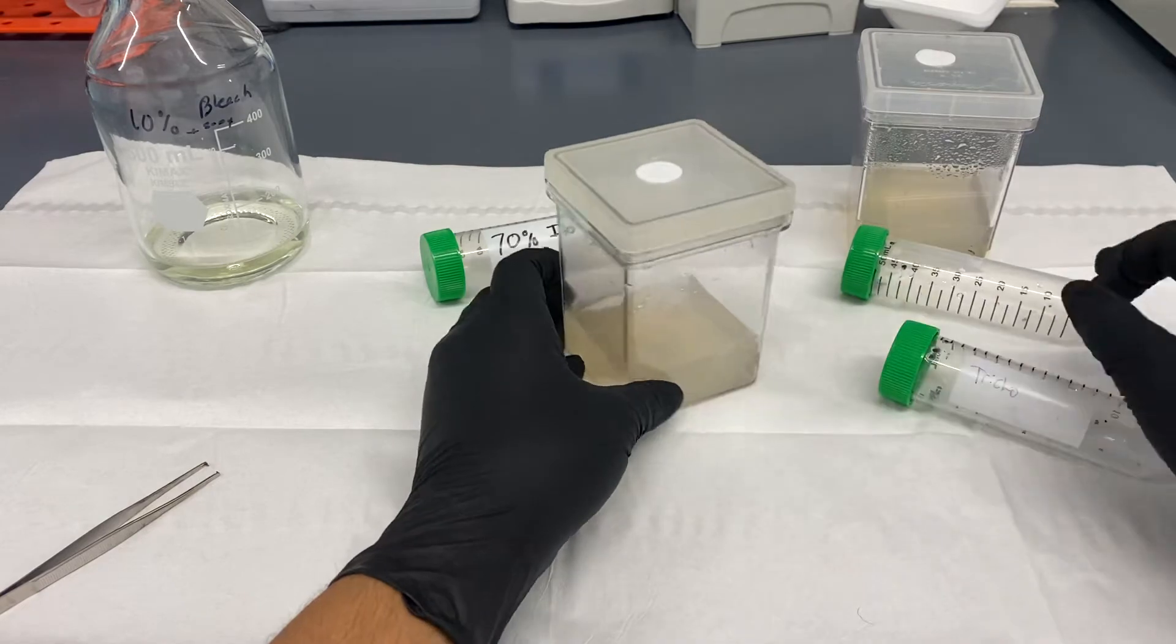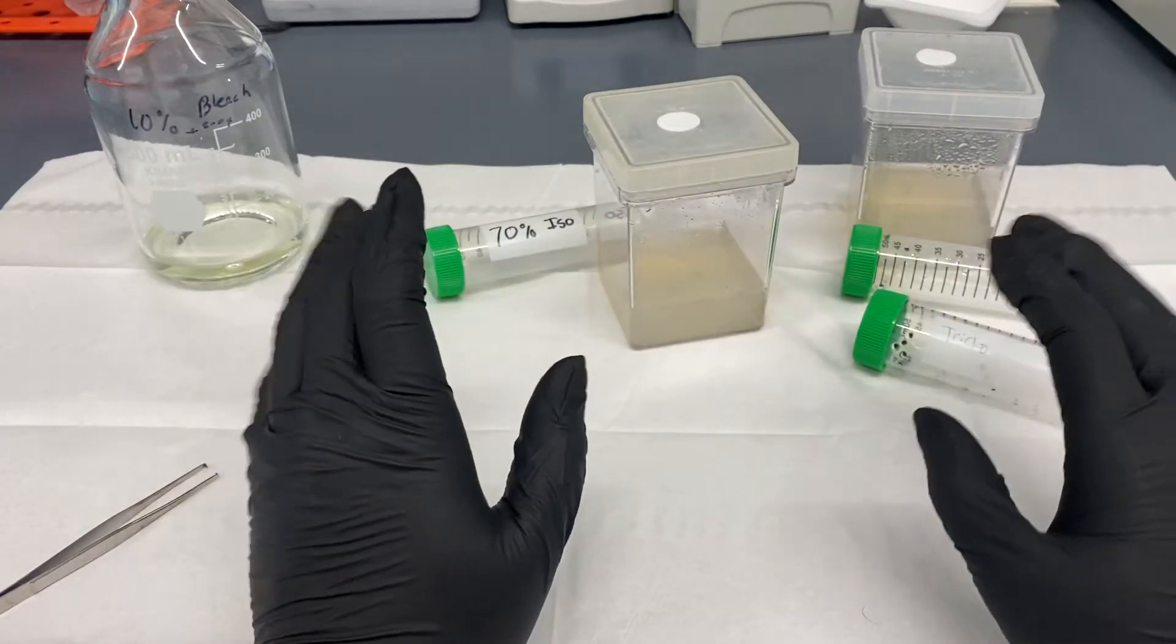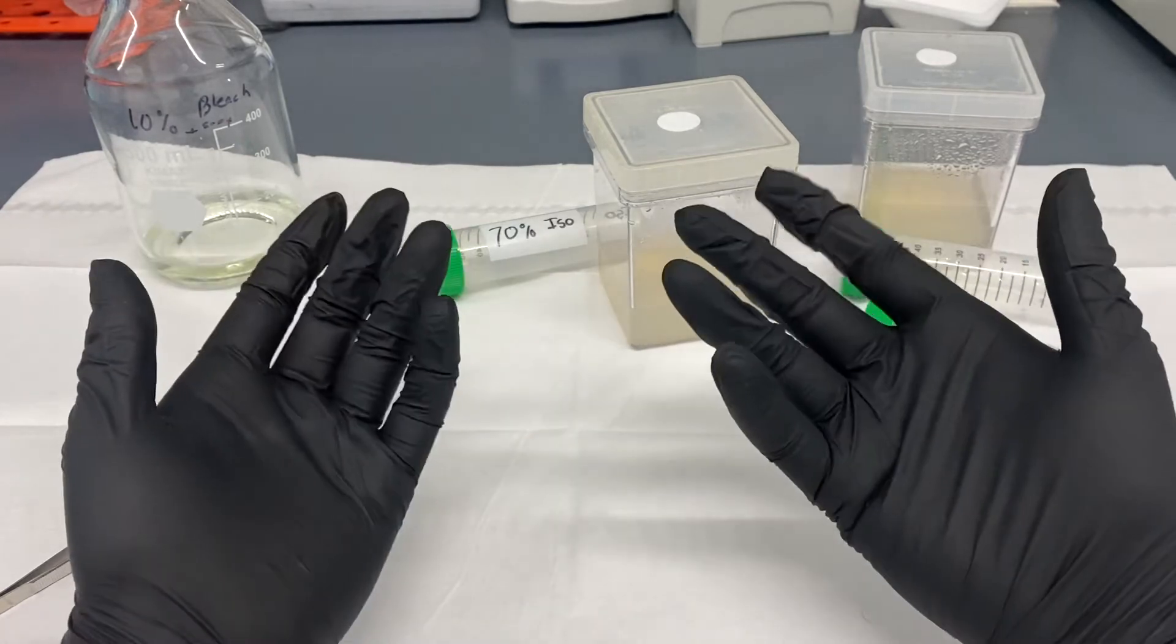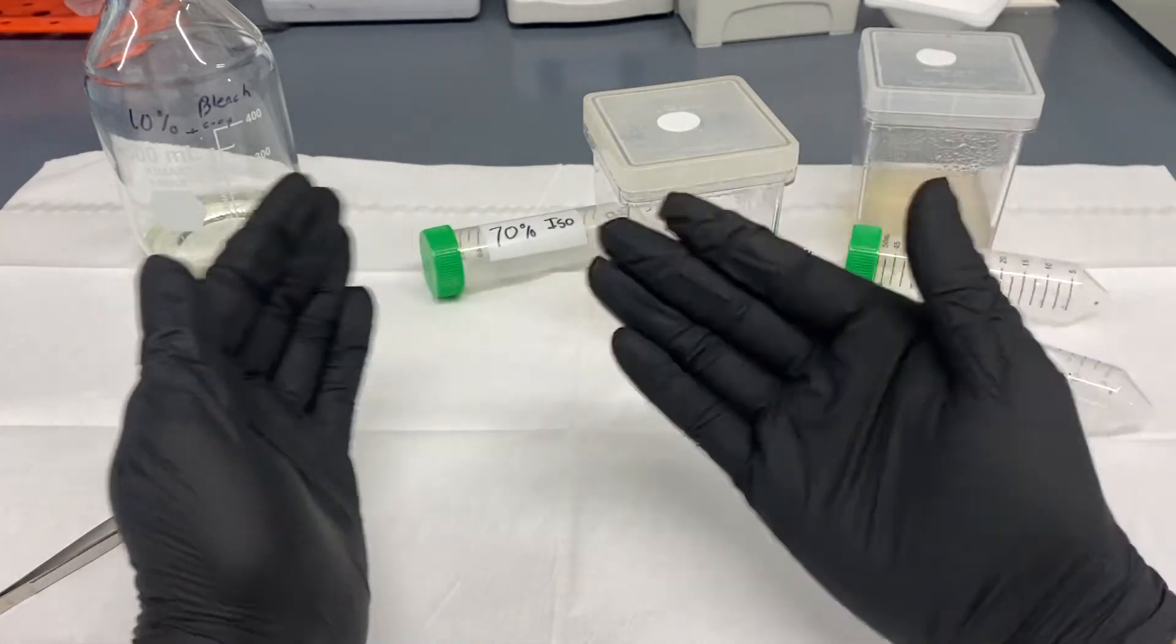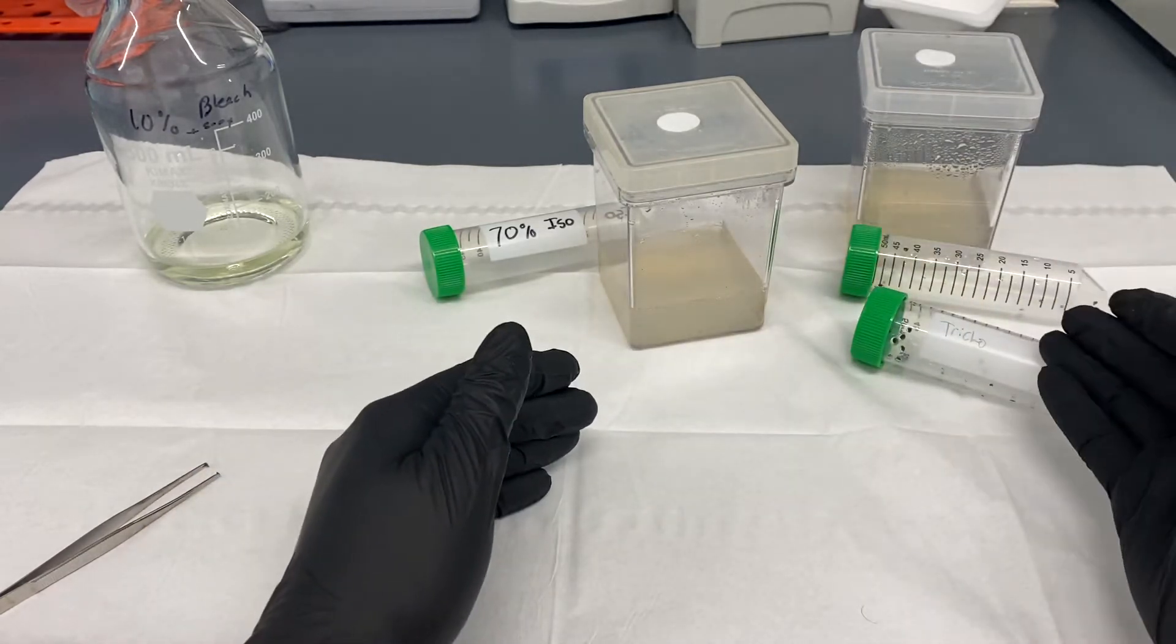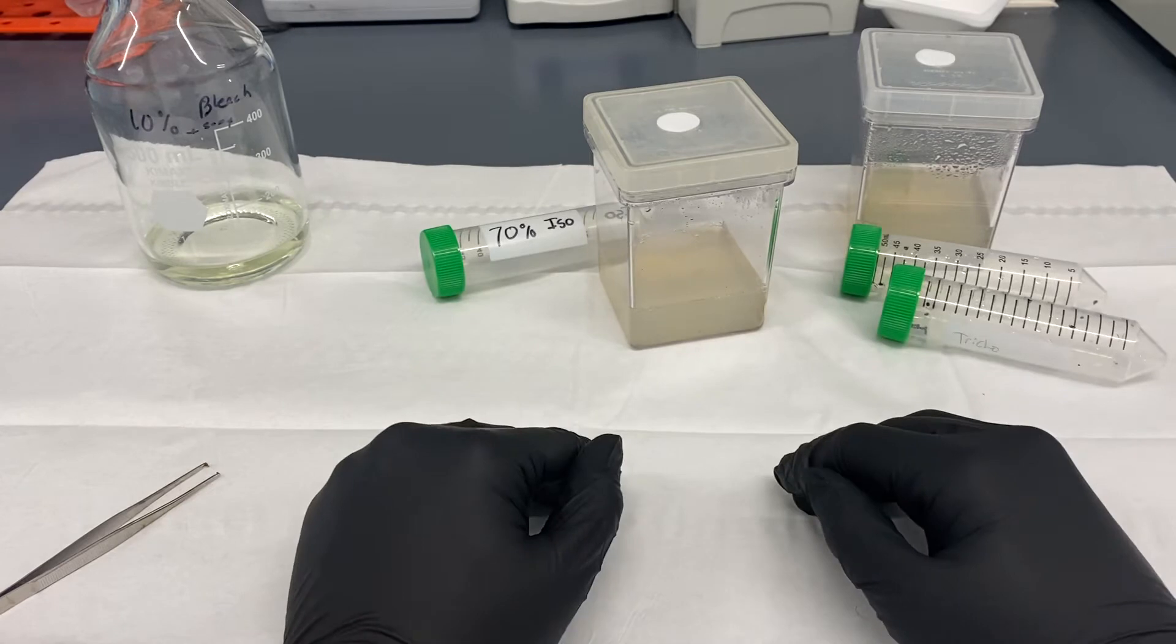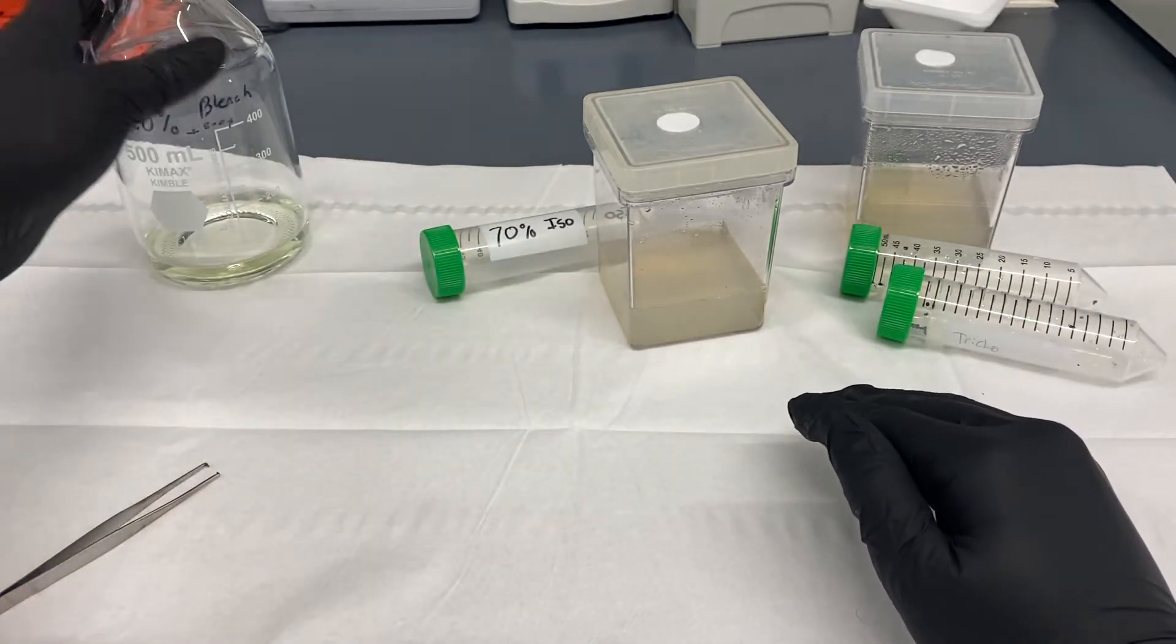So you need to make sure with any type of seeds or tissue that you completely wash it using a three-step process for cleaning up tissue or for cleaning up seeds, and I'm gonna show you guys in another video. In general it's always the same, the only thing that changes is the amount of time that you use this bleach solution depending on different plants.